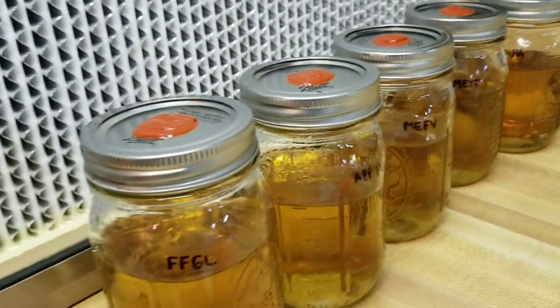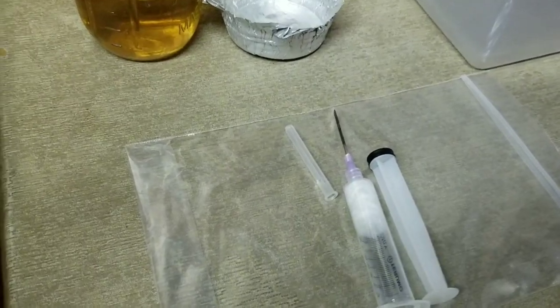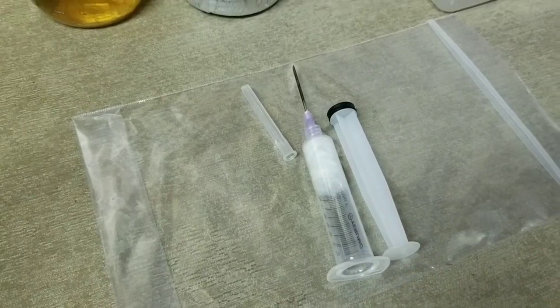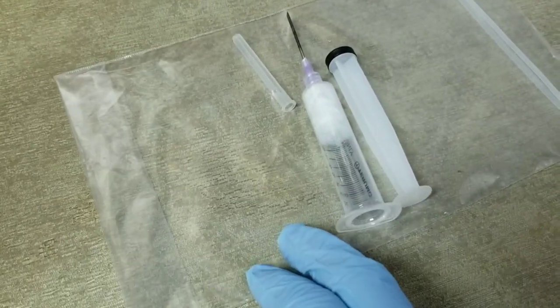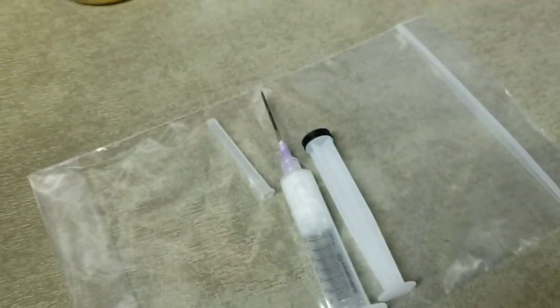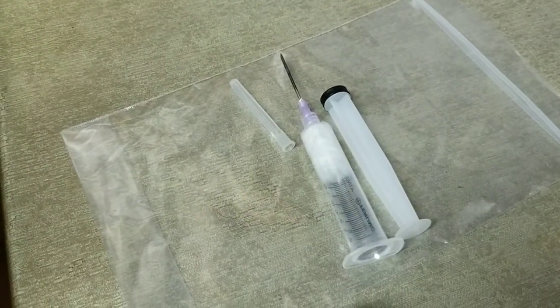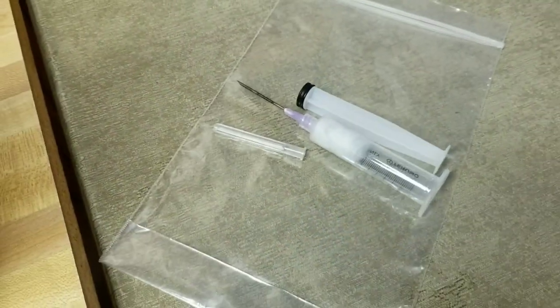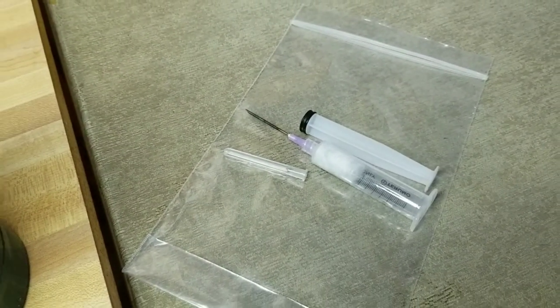All knocked up and labeled. One thing I wanted to mention: I've used this same syringe and polyfill setup probably 10 or 12 times now and it hasn't caused any contamination. I just store it in a zip-lock bag and reuse it when I do another batch. You don't have to make up a new polyfill syringe every time — you can use the same one several times.